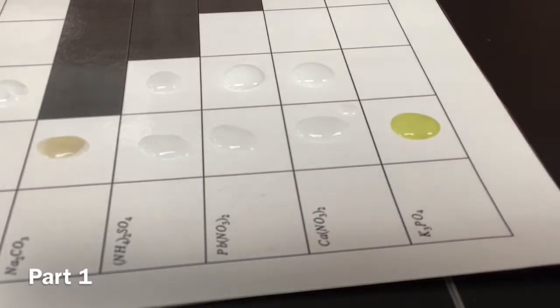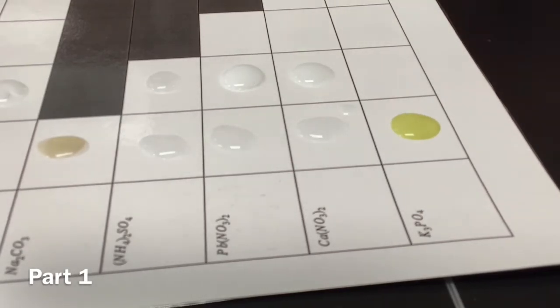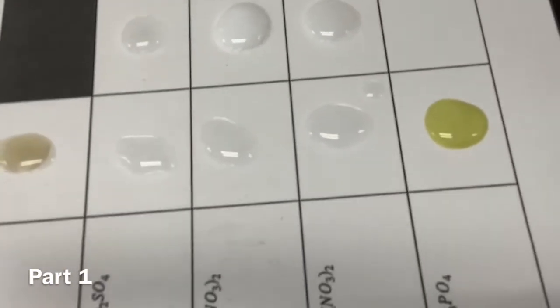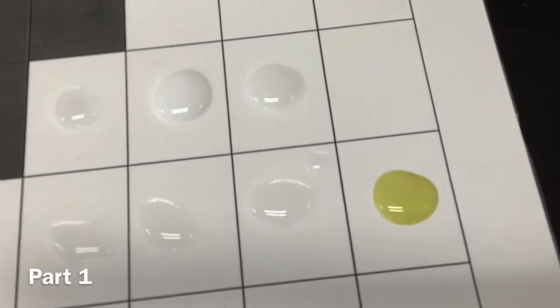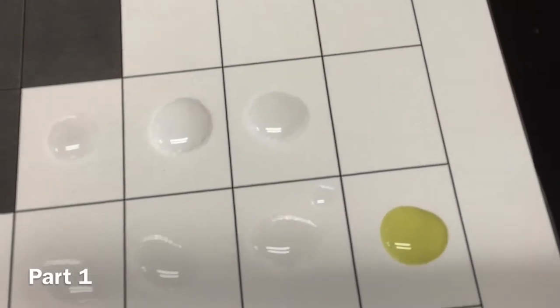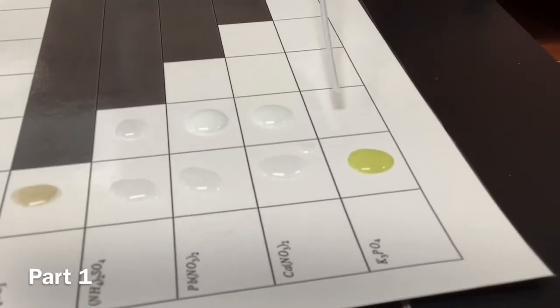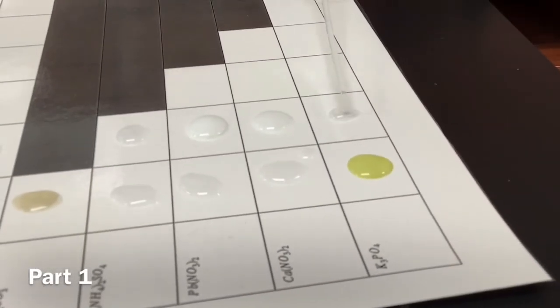Okay, so I'm not sure if you guys can see that, but that one became pretty cloudy. Yep, you can see that. So it's white and cloudy, like a lot of these other ones. Maybe that's a pattern with the Na2CO3, it becomes cloudy. All right, and then we're just gonna do this K3PO4 with the Na2CO3.